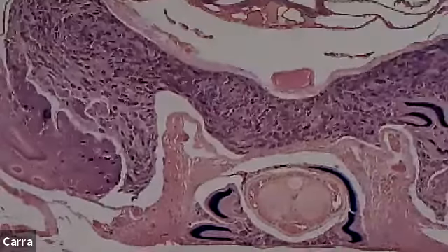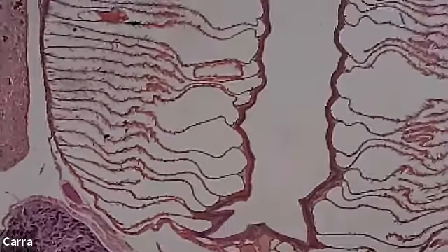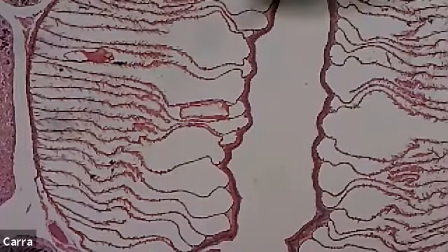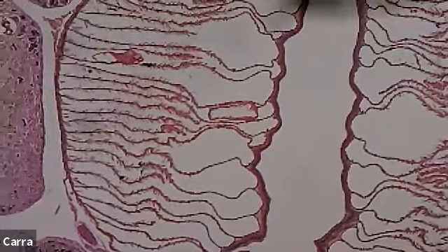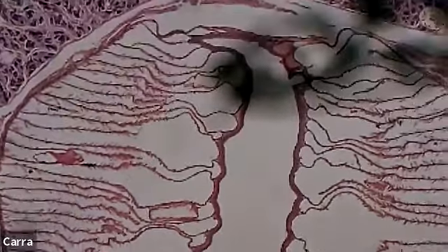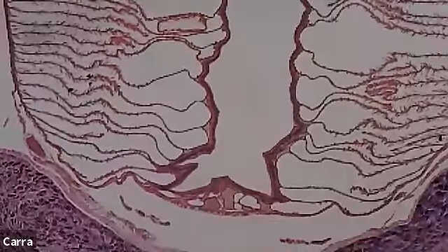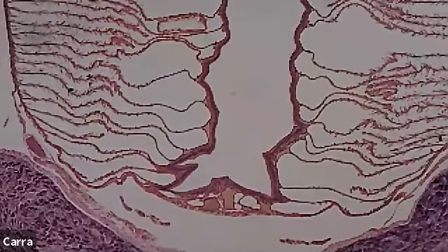Okay, so we're gonna move up here. And what I'm trying to get to is this middle part, okay? So see this big hole right in the middle. It should be right in the middle of your screen. That's actually gonna be the cavity of the digestive system. So that's gonna be our gastrovascular cavity. And since this is a cross section, all of the pink circular thing surrounding that, that's the digestive lining itself. So that's our endoderm, that's our gastrovascular lining. And so the cavity is on the inside and then the lining is on the outside.